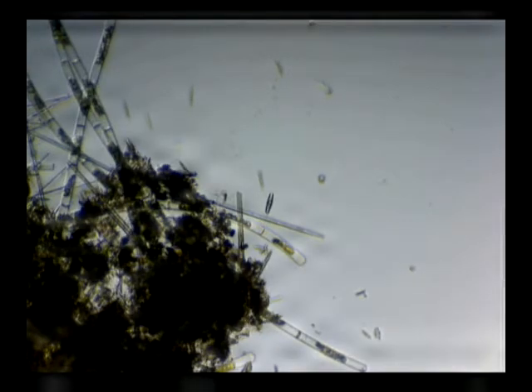I've got a special treat for you. Bear in mind you're going to see this in an edited version. Usually I do these videos so I like to be surprised right along with you — I see these things for the first time generally. Not this time. This is going to be different. Right there in the center you'll see a diatom — an oval-shaped diatom — with that roundish green organism floating around next to it, moving around there.